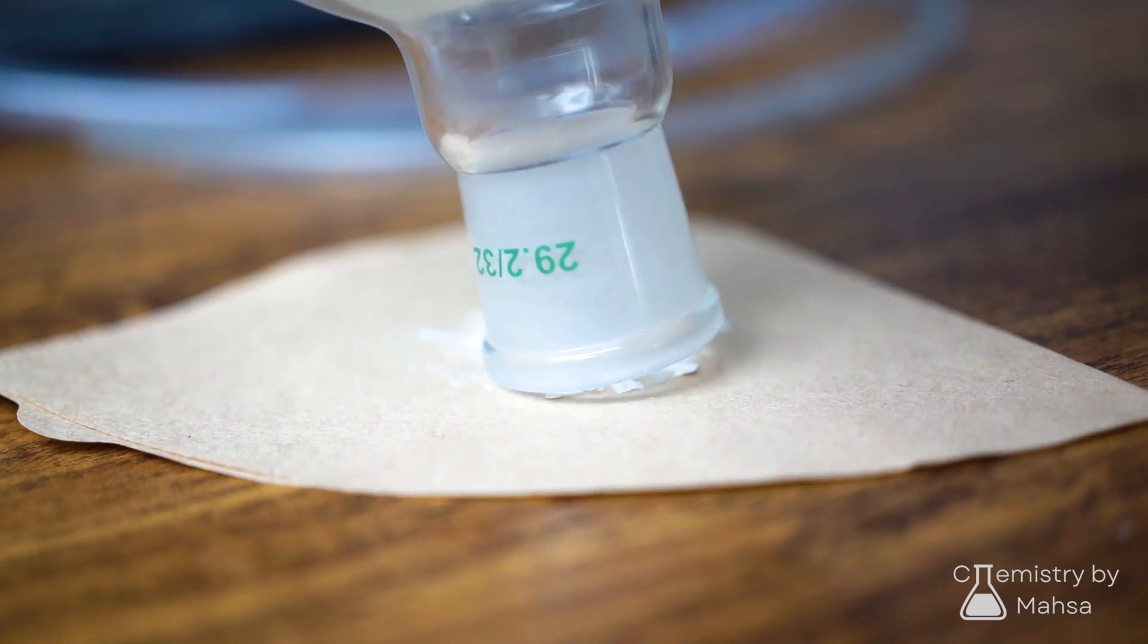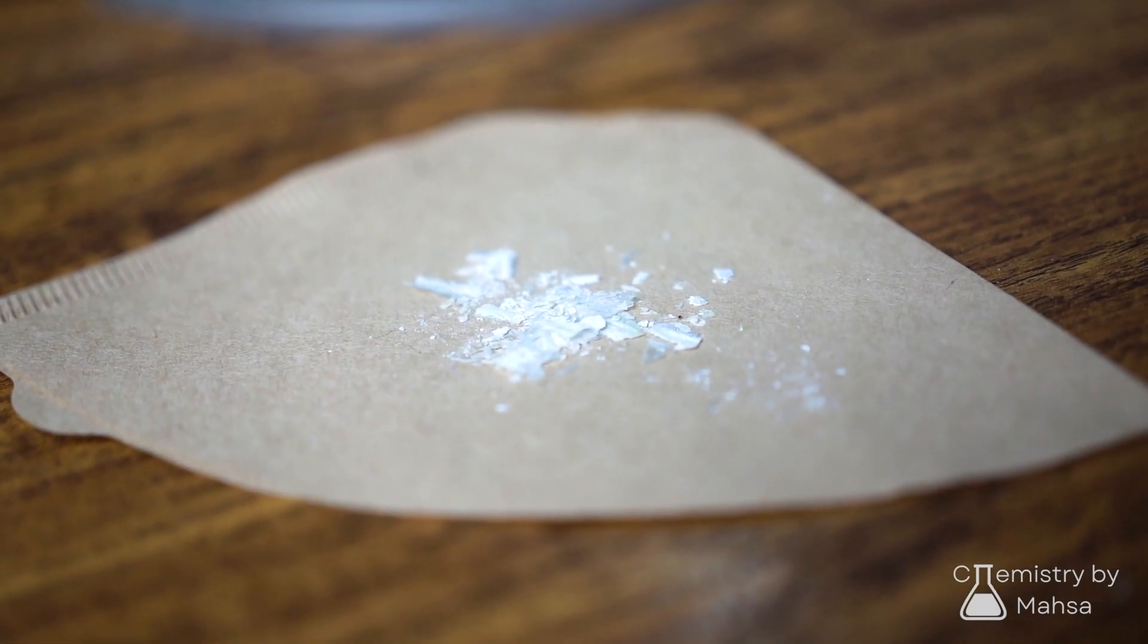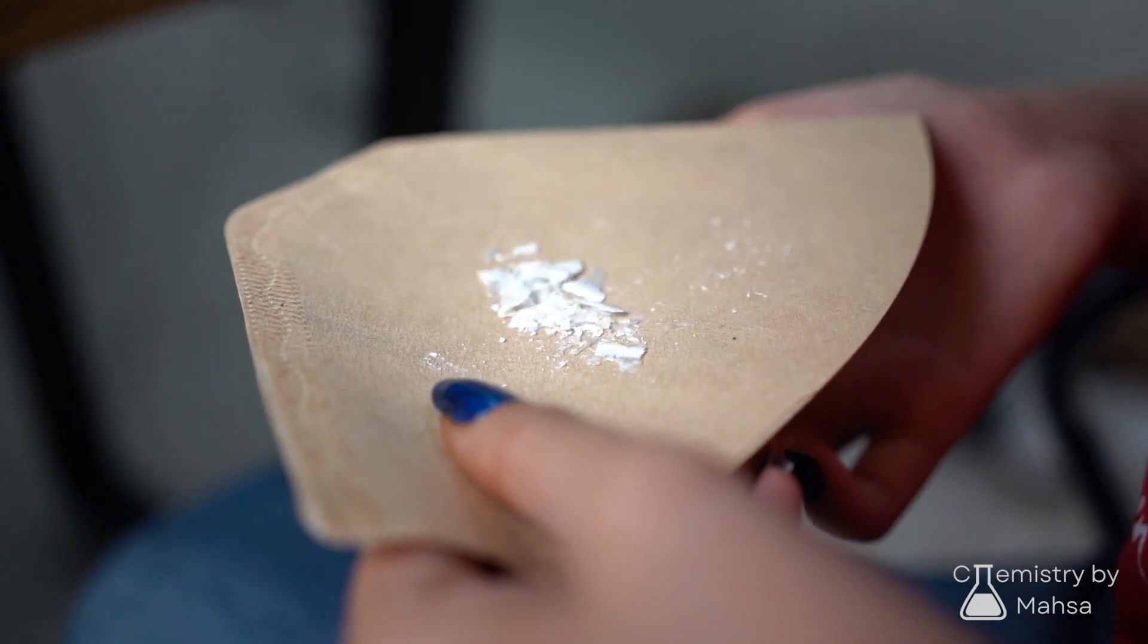Solvent extraction, steam distillation, solid liquid extraction, liquid liquid extraction, and so on were on the list. I chose solvent extraction and followed the standard procedure.